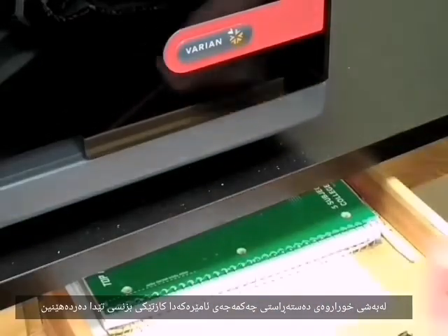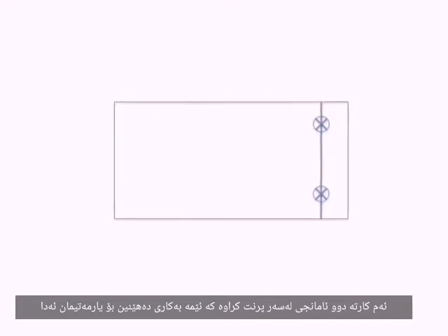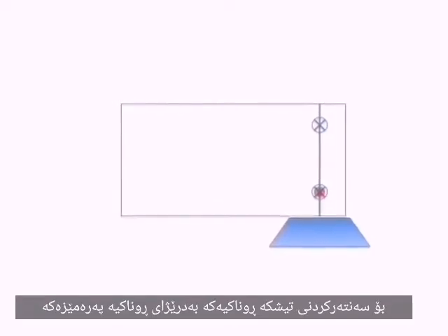In the right-hand drawer below the instrument, remove one of the Varian business cards. These cards have two targets printed on them that we will use to help us center the light beam along the center of the burner slot.